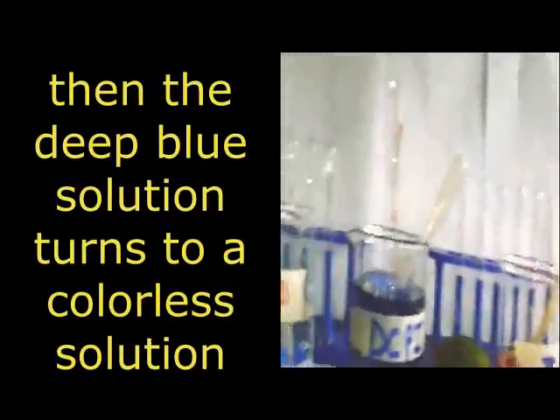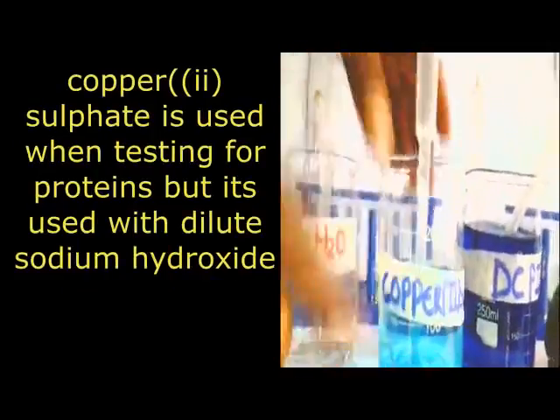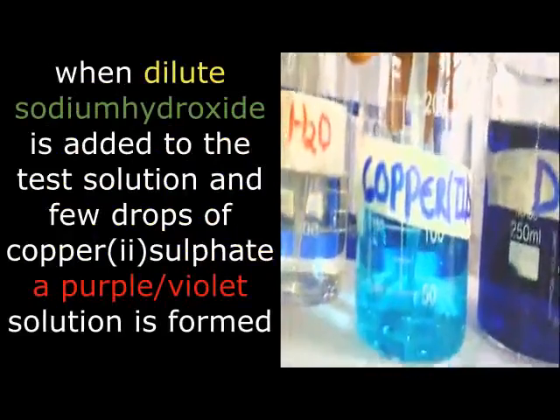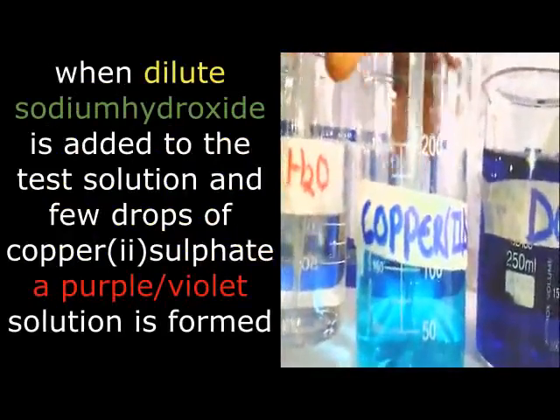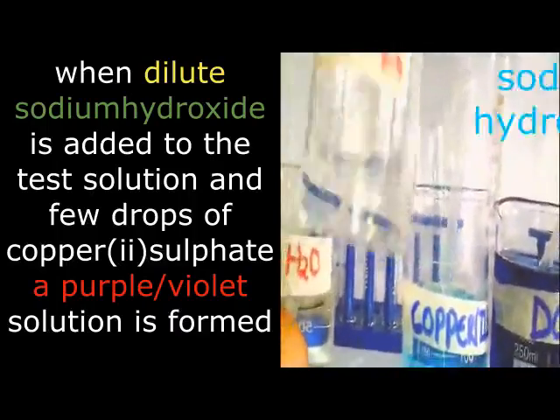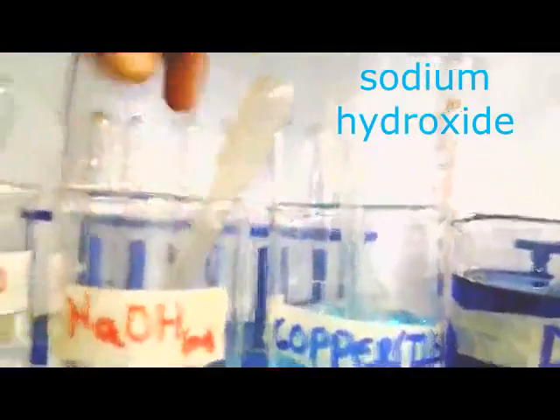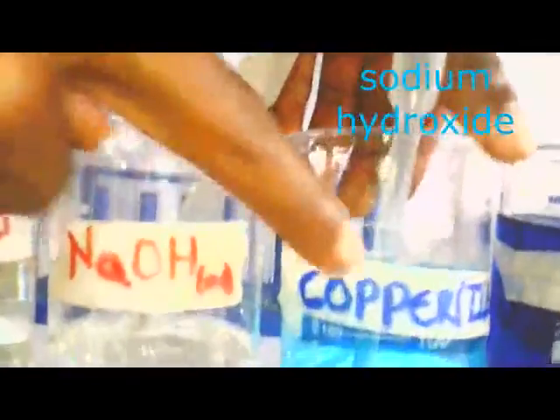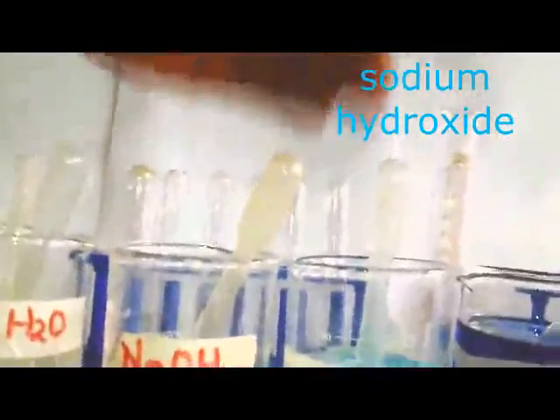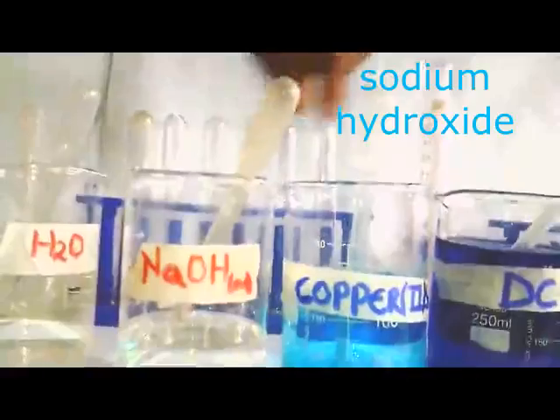Then another very important reagent is copper-2 sulfate. It is also light blue, as we are seeing, somewhat resembling Benedict's. We are going to use it in combination with another vital reagent, sodium hydroxide. You can see our sodium hydroxide is working together with the copper-2 sulfate. These two reagents we use when carrying out the protein test, and they give us what we call the Biuret test.